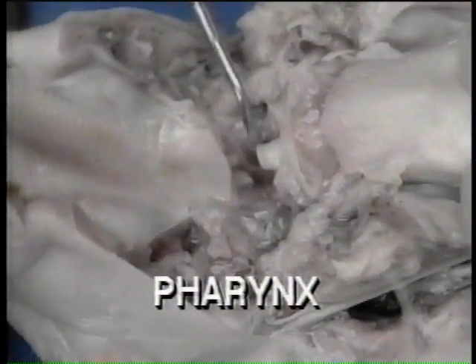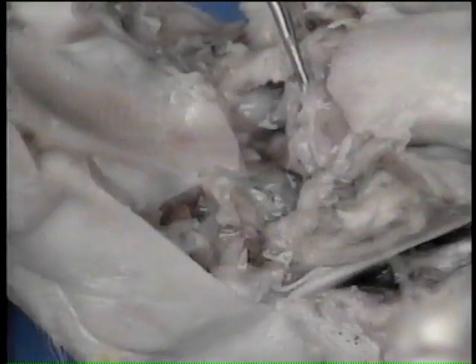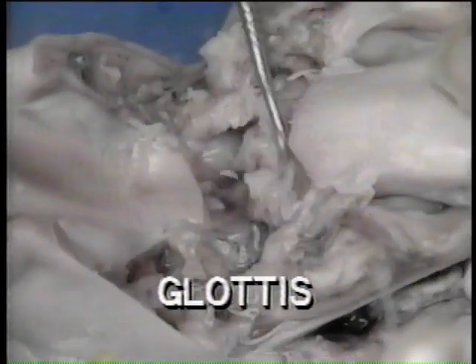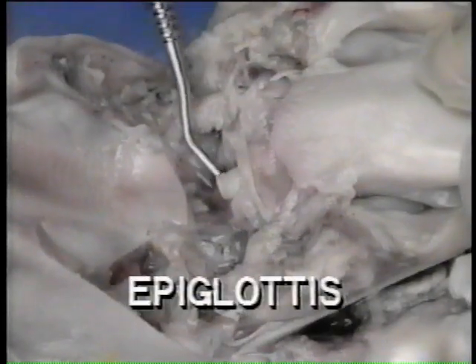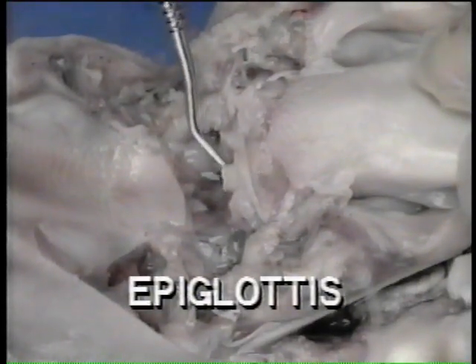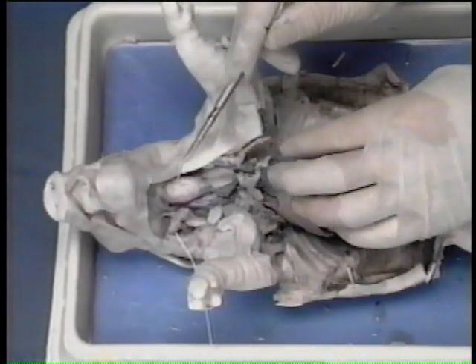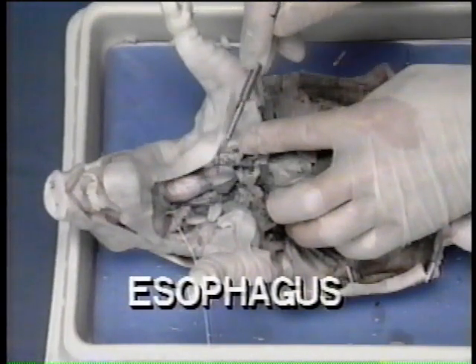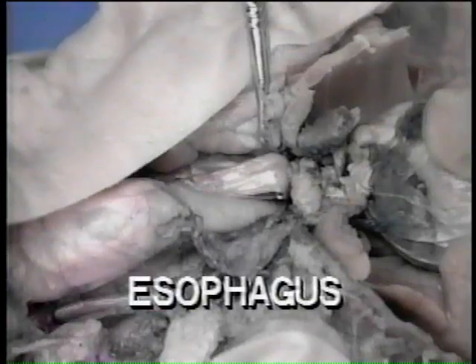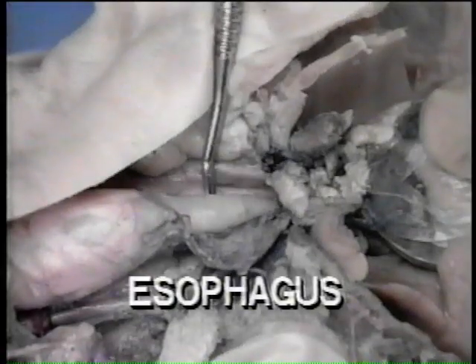The pharynx is the crossing of the air and food passages. The opening into the trachea or windpipe is called the glottis. Note the presence of a small white tab of cartilage. This is the epiglottis. It prevents food from getting into the trachea. The esophagus is the muscular tube leading from the pharynx to the stomach. Notice its close association with the trachea.